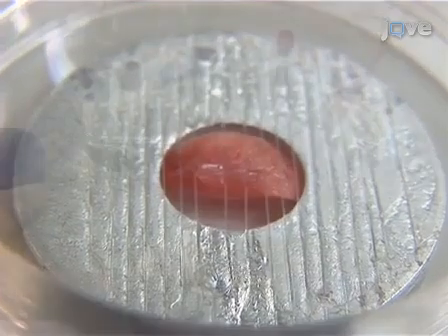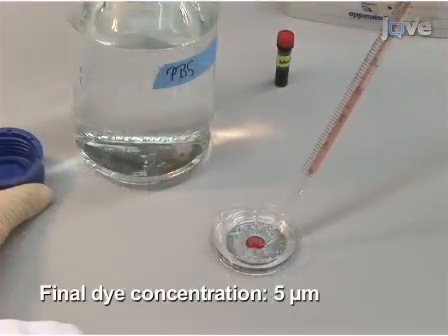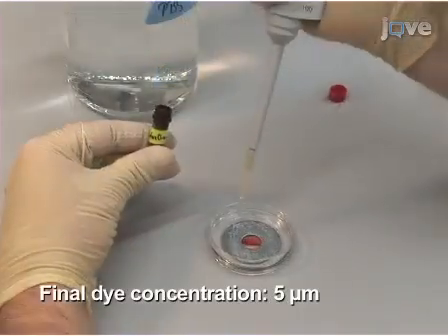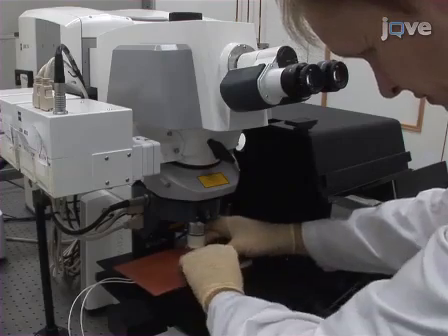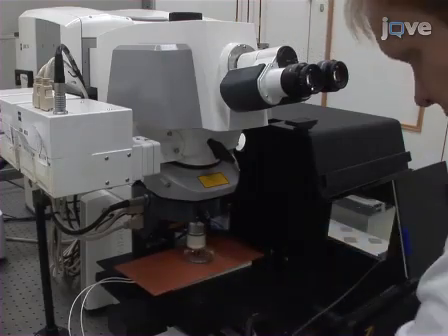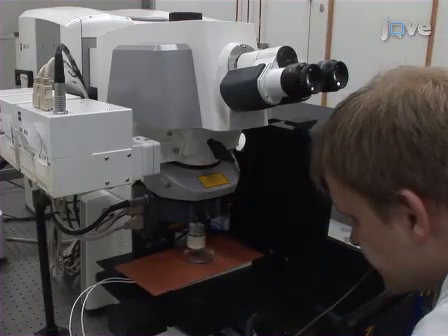Fill the dish with 10 milliliters of PBS and add 10 microliters of Sytox Orange dye. Finally, install the petri dish containing the lung tissue under the microscope objective so that the buffer can be warmed by a temperature sensor-controlled heater to 37 degrees Celsius.